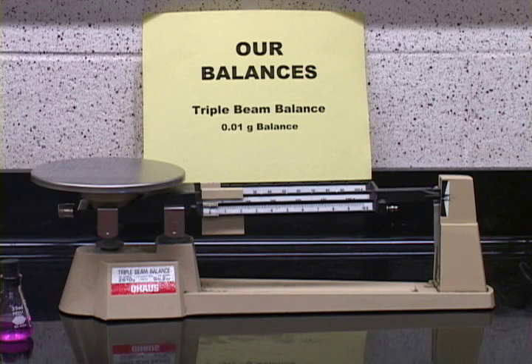Remember, whenever you weigh something, you really have to make 2 weighings. On the analytical balance that we just saw before, remember, you first of all made sure that it read 0. That was your first weighing, the 0.000 weighing. And then you made the weighing, and so the difference between those 2 weighings was the weight of the flask.